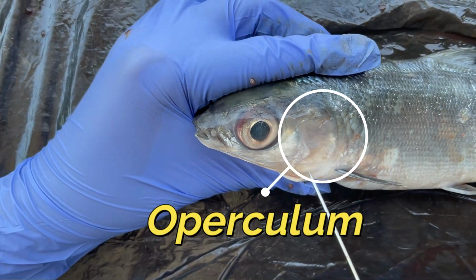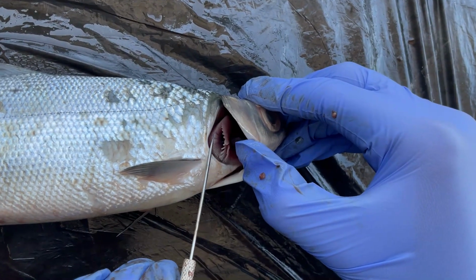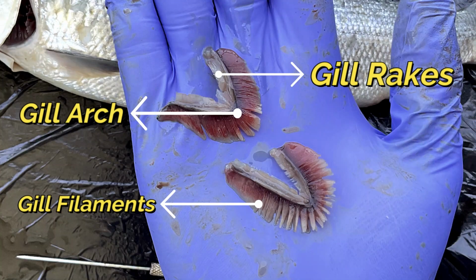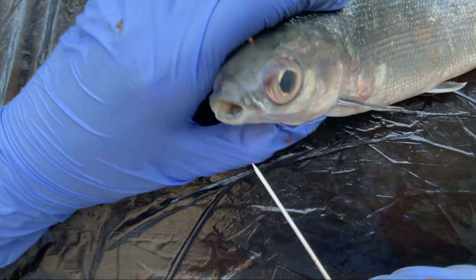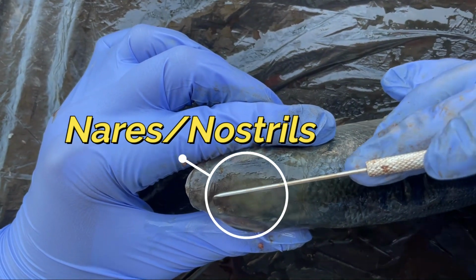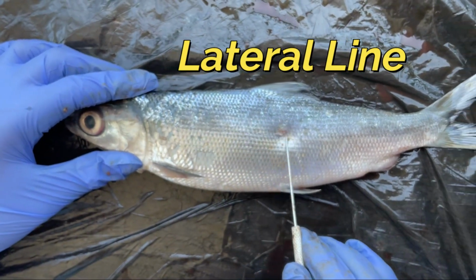operculum, gills that can be found inside. These gills are composed of gill filaments, gill arch, and the gill rakers. Mandible, nares or nostrils. This part of the fish is called the lateral line.